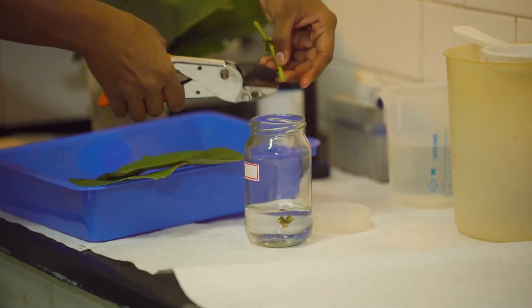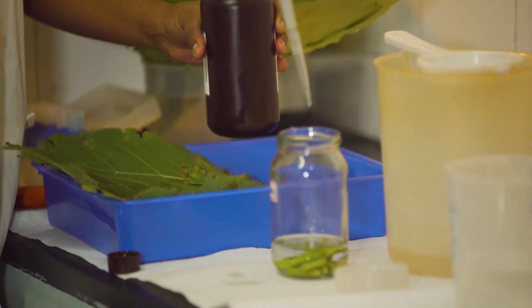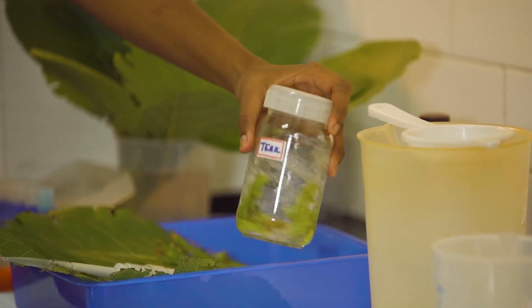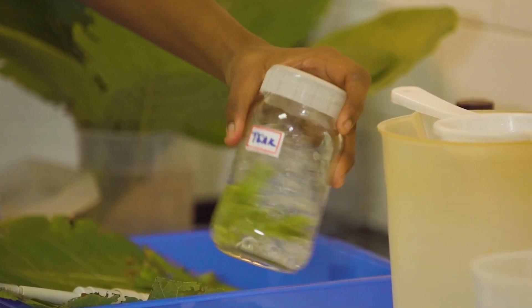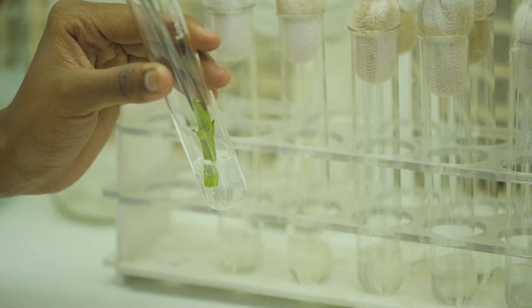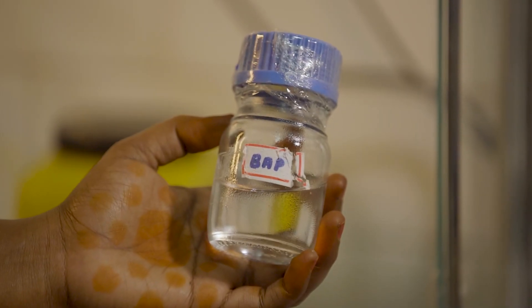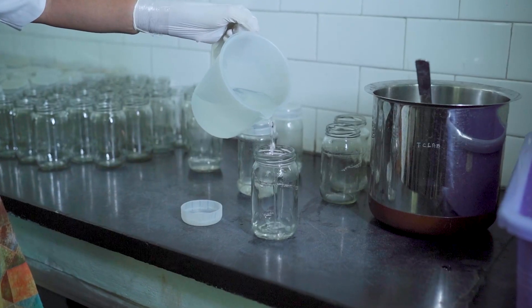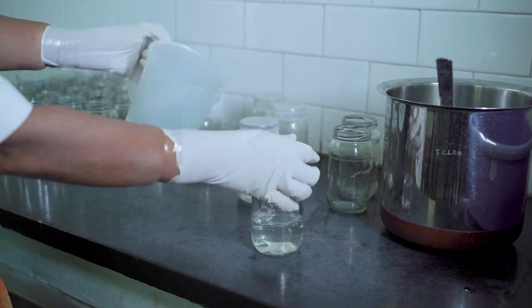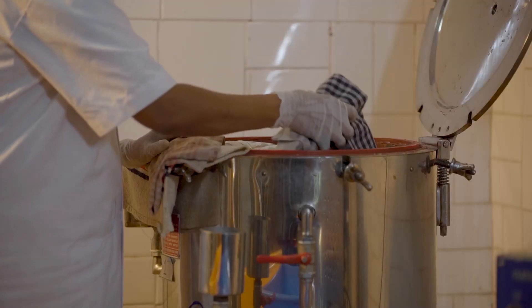Nodal segments from these stocks are collected and brought to the laboratory where they are soaked in appropriate sterile solutions to remove dirt, spores and microorganisms. They are then transferred into a culture medium which comprises macro and micronutrients. Growth hormones are also included. The medium is then allocated uniformly into culture bottles, manually capped well and sterilized in an autoclave.